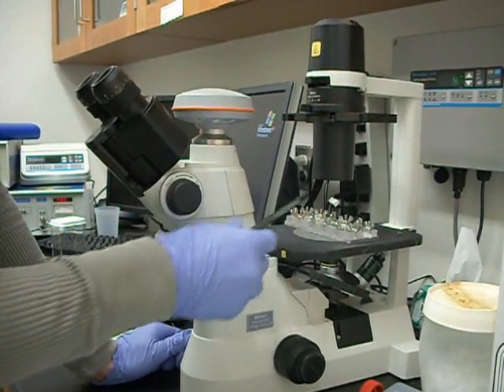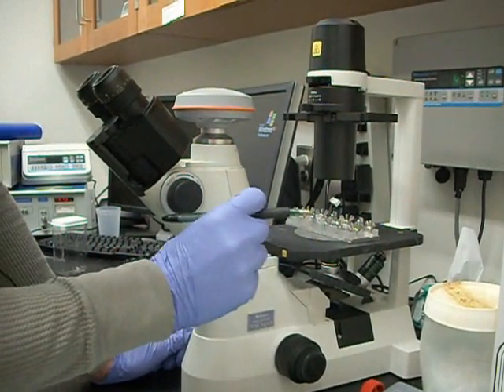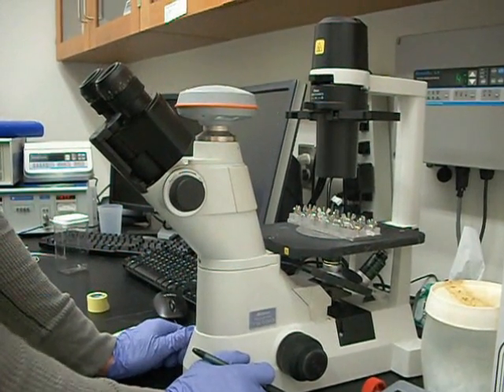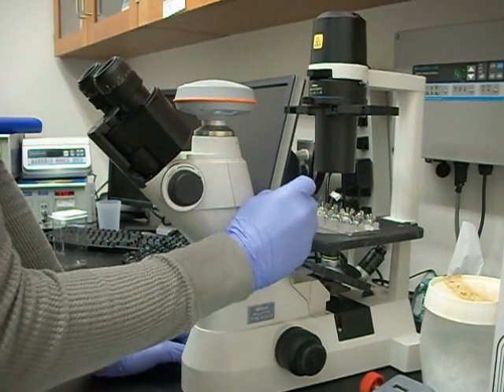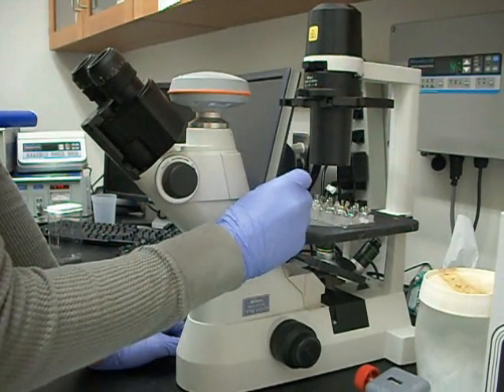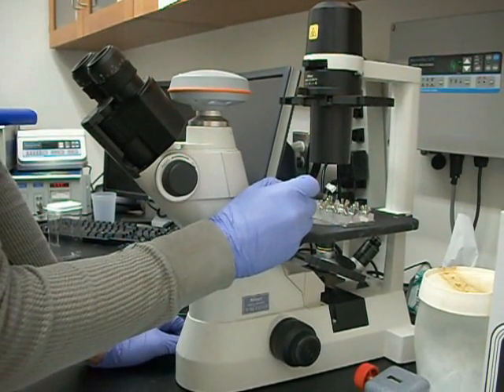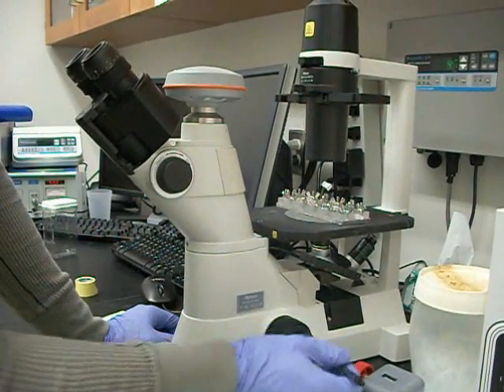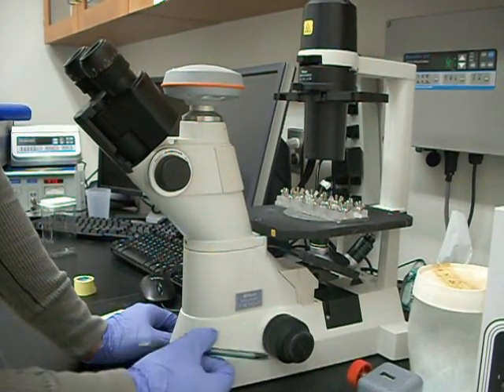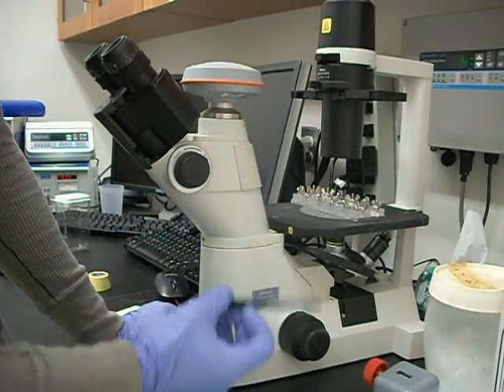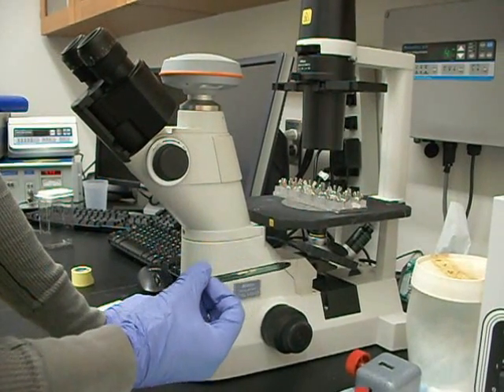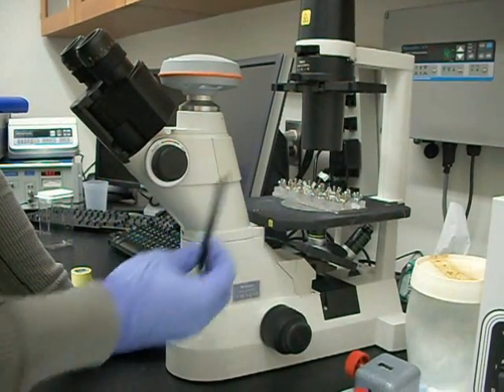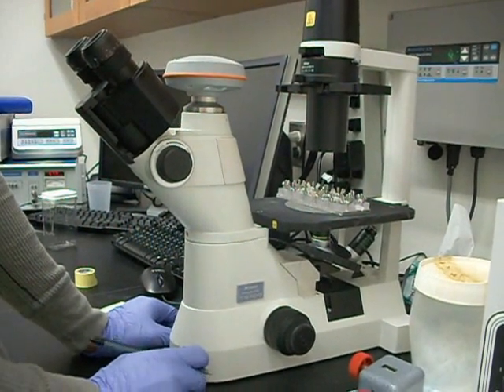I always measure the height in the flow chamber just because that gasket could have been compressed a little bit and it'll change day to day, maybe 20 microns. So all I'm going to do is focus the microscope on some scratches on the top surface of the flow chamber and then I'm going to go down and focus it on the cells and see how many tick marks we move and then multiply that by, in this case, 1.33, which is the index of refraction of the media inside there to get the height in microns.